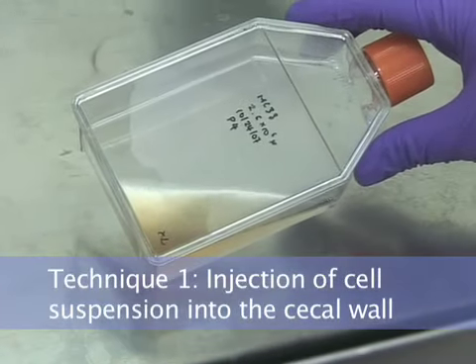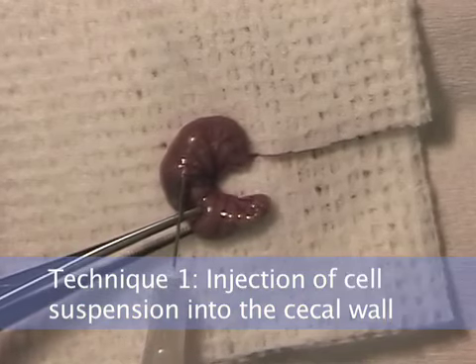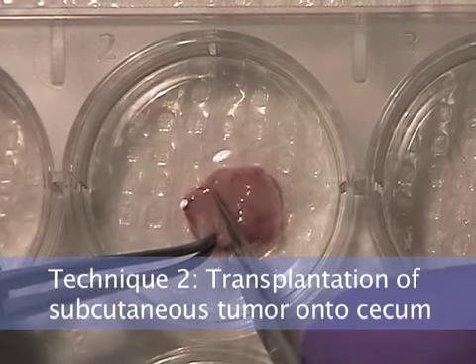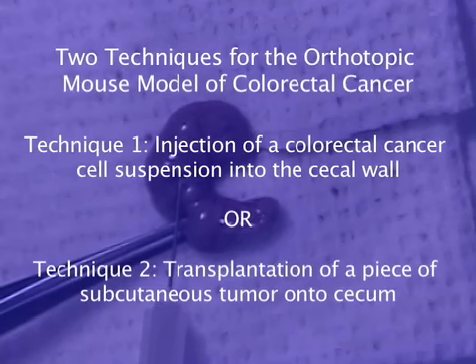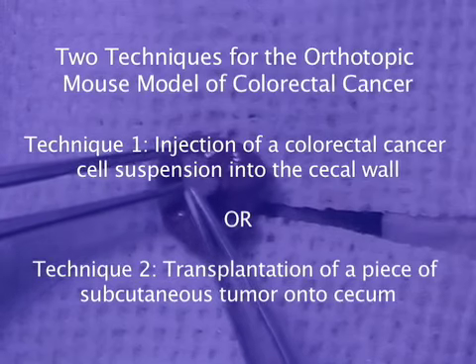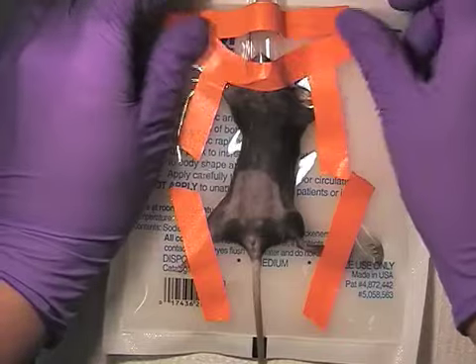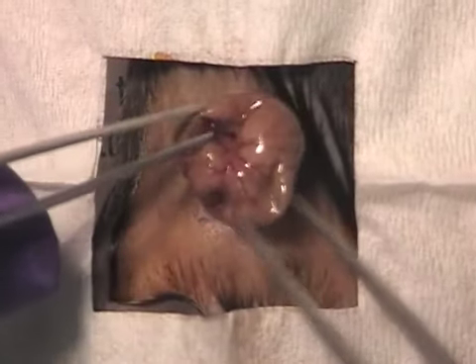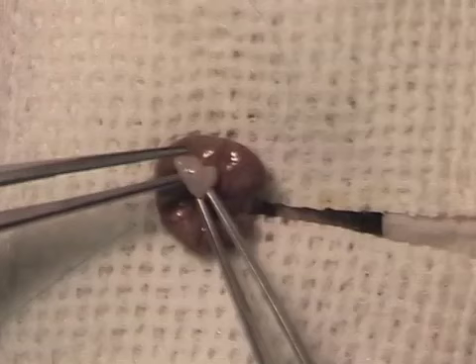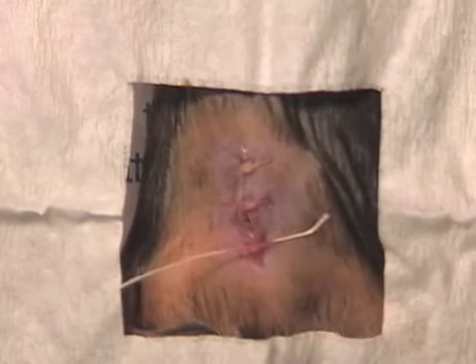One technique involves injection of a colorectal cancer cell suspension into the cecal wall. The other technique involves transplantation of a piece of subcutaneous tumor onto the cecum. Both techniques are similar and involve the following steps. 1. Cell or tumor preparation. 2. Mouse preparation, laparotomy, and exposure of the cecum. 3. Injection of cells or transplantation of tumor. And 4. Mouse abdominal wall closure and recovery. Let's get started.